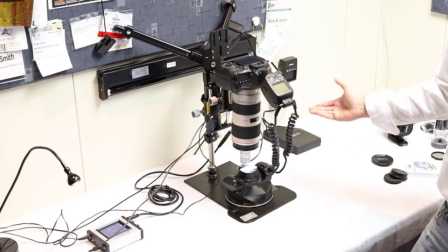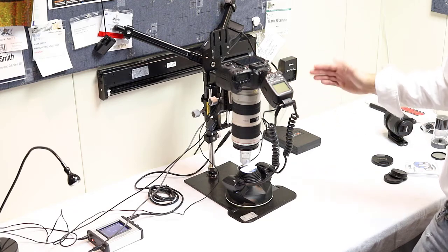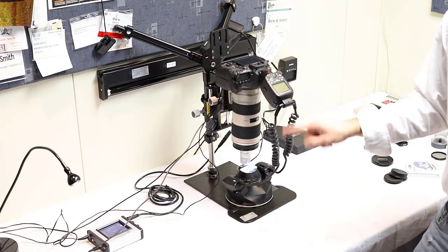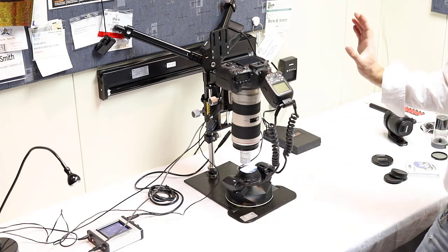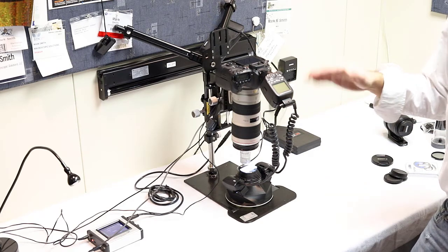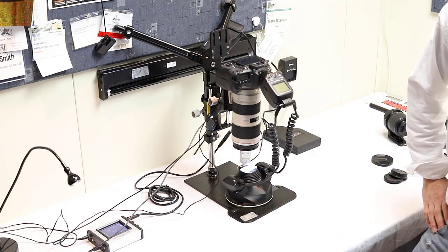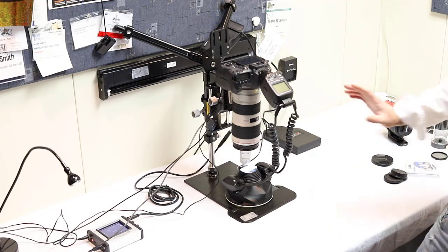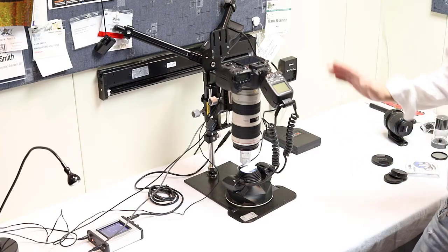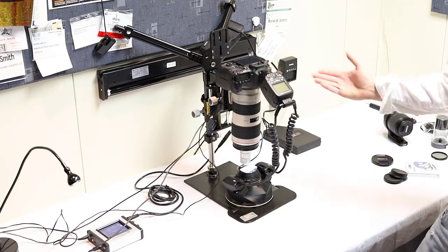So again, biologists, as simple as put the slide on, take the slide off, on, off, and really just hit run again on your controller every time. Geologists, if you need to use cross polarization, you're going to have to swap the filter on and off. It's just like changing the analyzer in a petrographic microscope. And again, this is going to give you really high quality results just because of the way that we're using light. But that's how you'd switch it over.